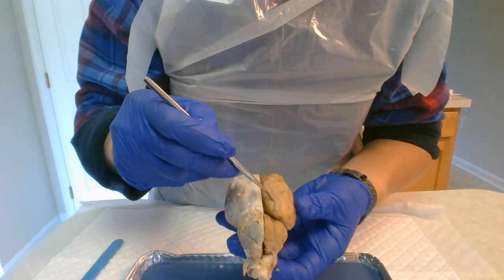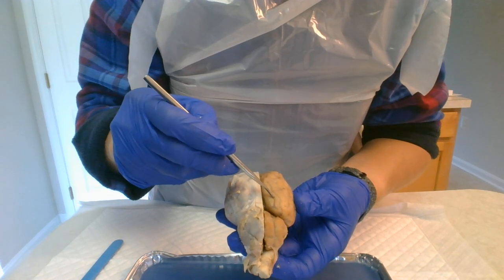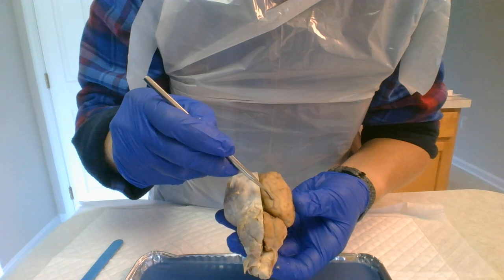Then there's the pia mater, which is very clear and is directly connected to the central nervous system. I'm actually not puncturing it — I'm still above it here along the sulcus.